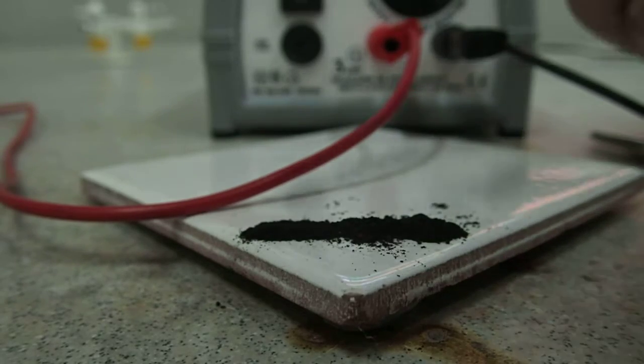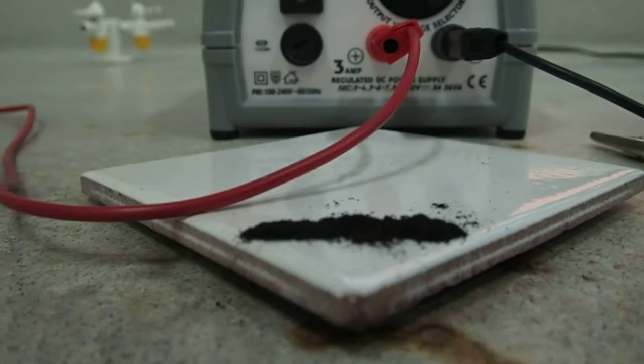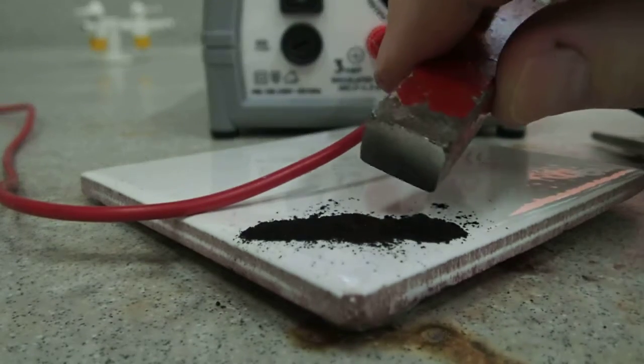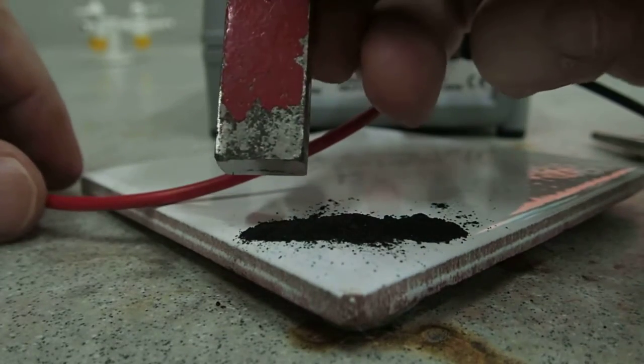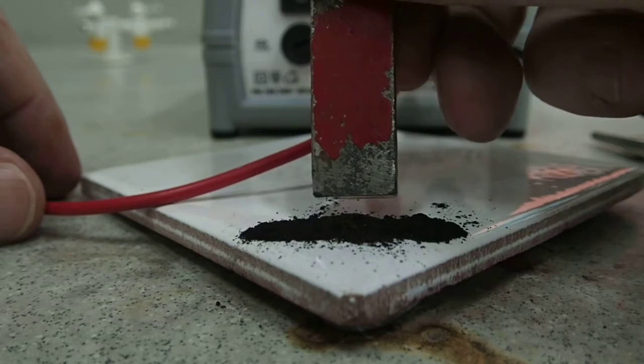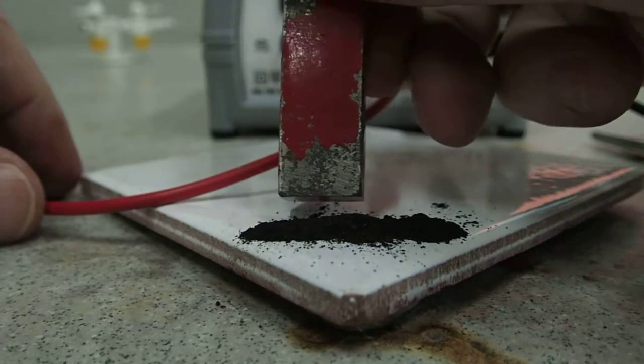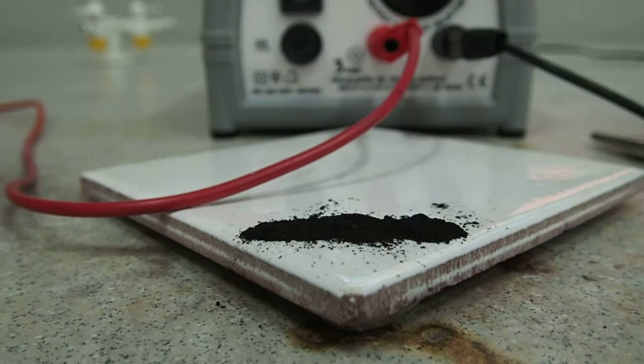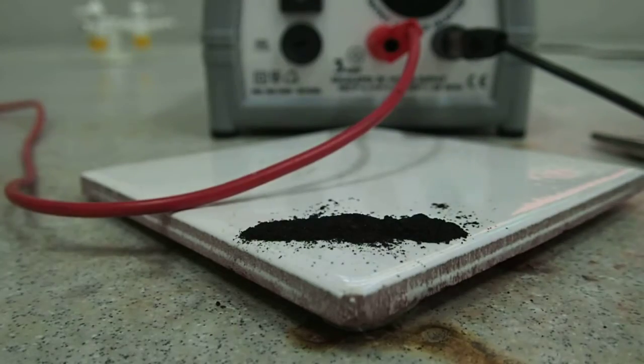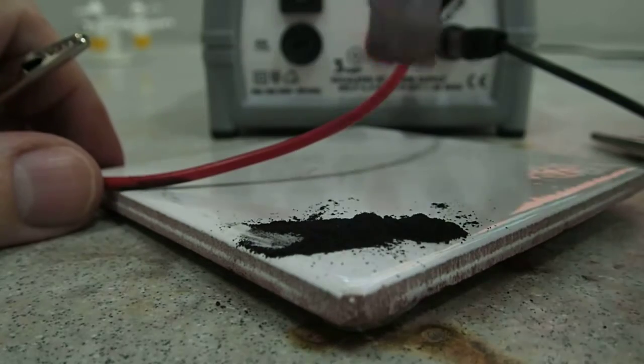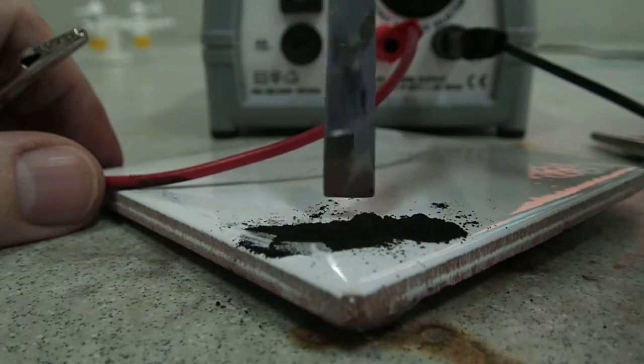So that we can use a pencil lead to heat it. That should be enough. Next thing to do at this stage is to demonstrate that the mixture is in fact not magnetic. If you put the magnet close to the surface of the mixture, you should see that nothing really is going on. Clear. Okay, next thing, take a pencil lead and clasp it in two.